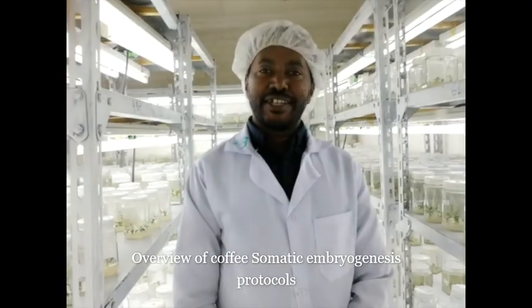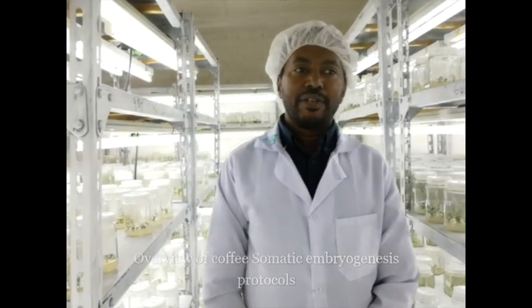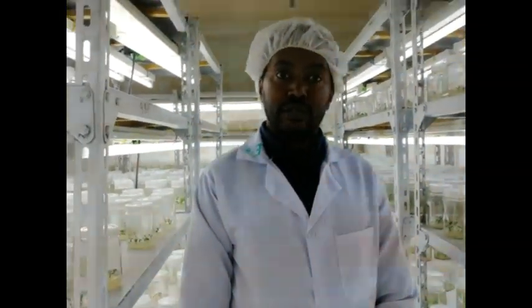Thank you. My name is Elias. I'm a researcher at Jimma Agricultural Research Center, Plant Biotechnology Laboratory. Currently, we are doing coffee somatic embryogenesis using 3 protocols. The first is Van Boxtel and Berthouly. The second is Teixeira et al., 2004. And the third one is the JARC protocol.